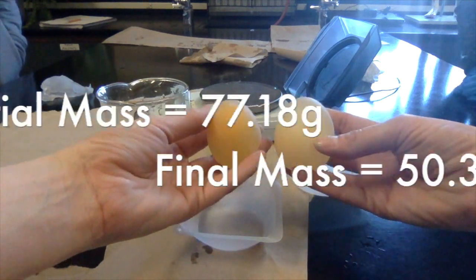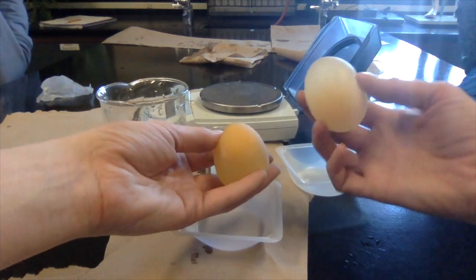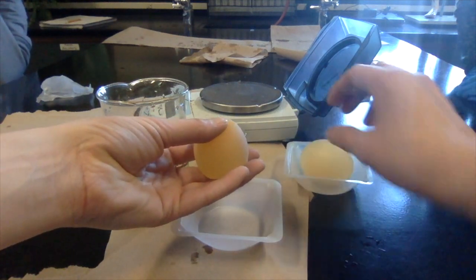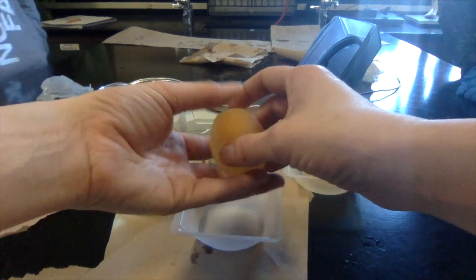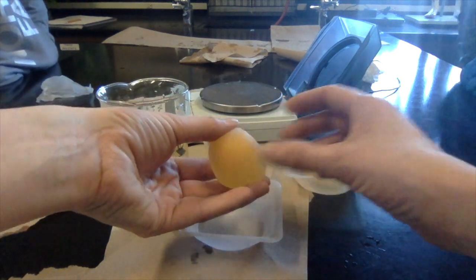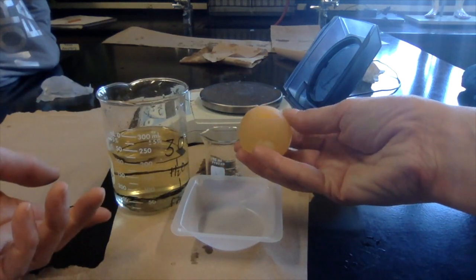So what happened to our egg? Our egg got smaller, right? This is approximately what the egg size would have been. So what left? The shell. Well, the shell wasn't there to begin with. But what left? Was it water or fructose? Not sure yet. So we're going to look at all the results. This one definitely got smaller. So it lost something.